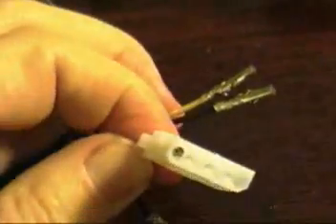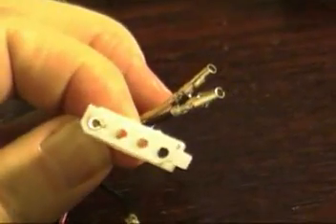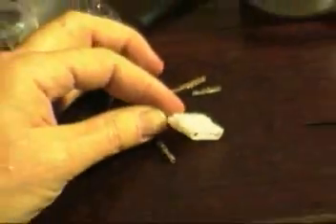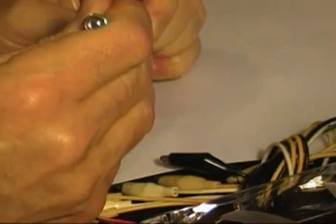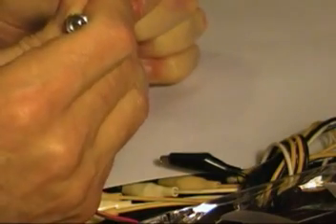I'm going to cut this plug off. You have to get these things with the ears out of these little plastic connectors, so I do that with a tiny little screwdriver — slide it in there next to the connector and try to bend those ears inward so that the connectors will come out. You've got to be gentle; if you press it too much it's going to break off. Just gently press it in and then gently pull on the wire. If you pull on the wire too much, it will probably break off.